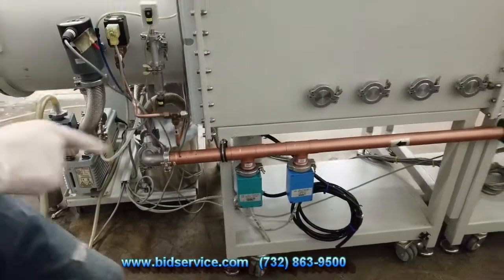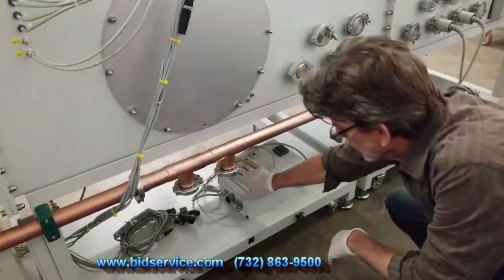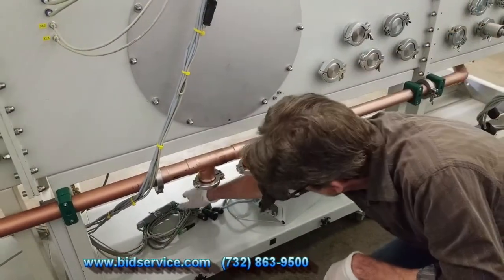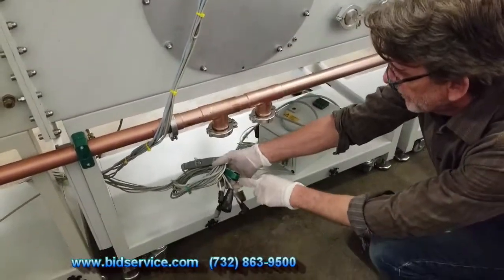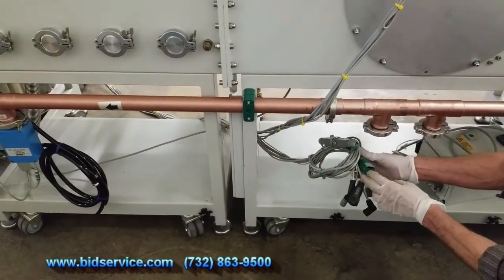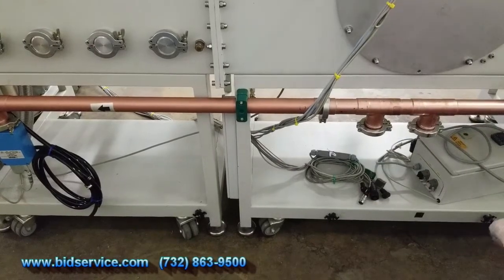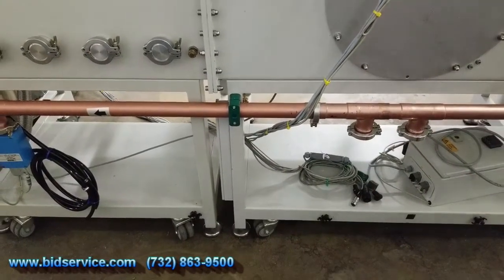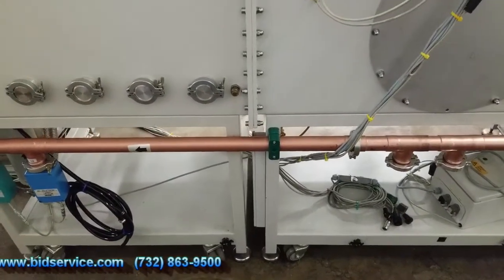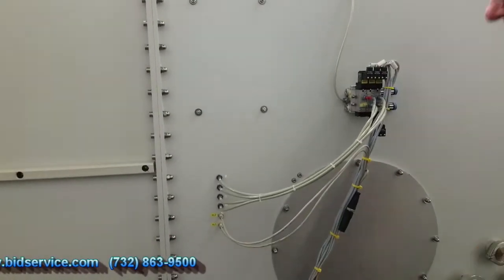And the two other things, I took off the temperature controller box here, and I was able to find the interlock that was sending an error to the screen, and I just put a jumper in it on this cable here. The overtemp sensor indicator that we kept getting on the screen, so now that's gone. You won't get that error. We still have this connected. I will disconnect this and bring it down here when we ship it.